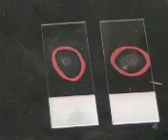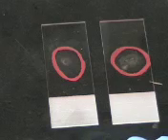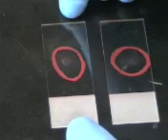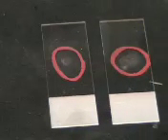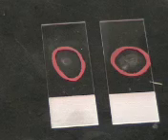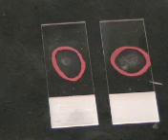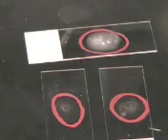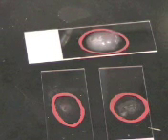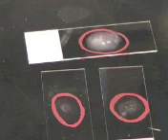It's been about 3 to 5 minutes now, and as you can see, our bacteria look nice and dry. Here's the one from our plate, and from our liquid culture. Now I want to show you some things that you shouldn't do. Here's one that has way too much bacteria. You don't want to see clumps, it shouldn't be cloudy, it didn't even have time to dry, so you don't want that to happen.